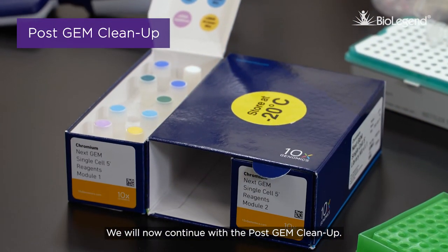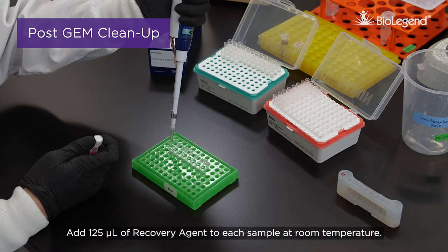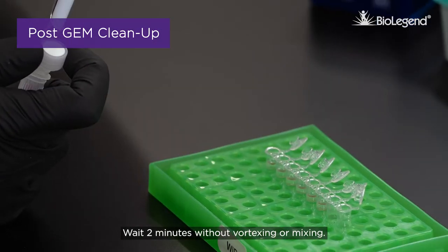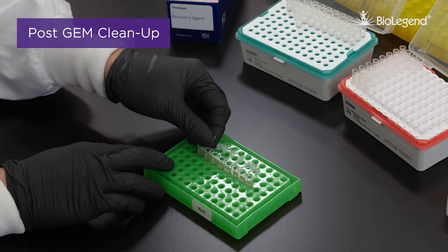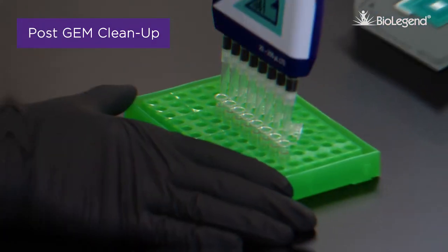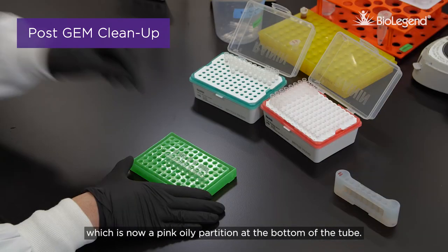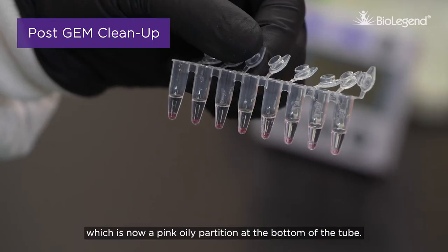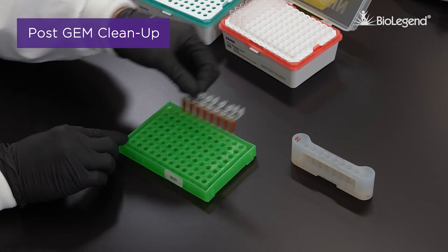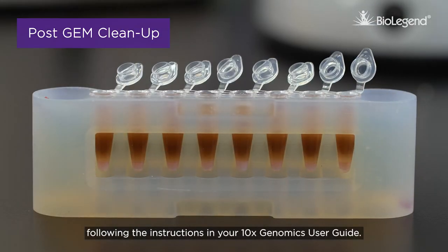We will now continue with the post-GEM cleanup. Add 125 microliters of recovery agent to each sample at room temperature. Wait 2 minutes without vortexing or mixing. Slowly remove and discard the 125 microliters of recovery agent, which is now a pink, oily partition at the bottom of the tube. Do not aspirate the aqueous sample. Use the DynaBeads Cleanup Mix following the instructions in your 10x Genomics User Guide.